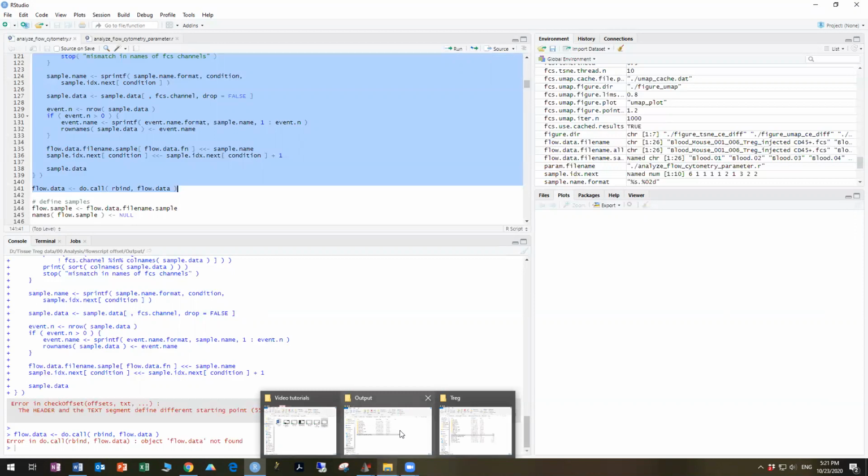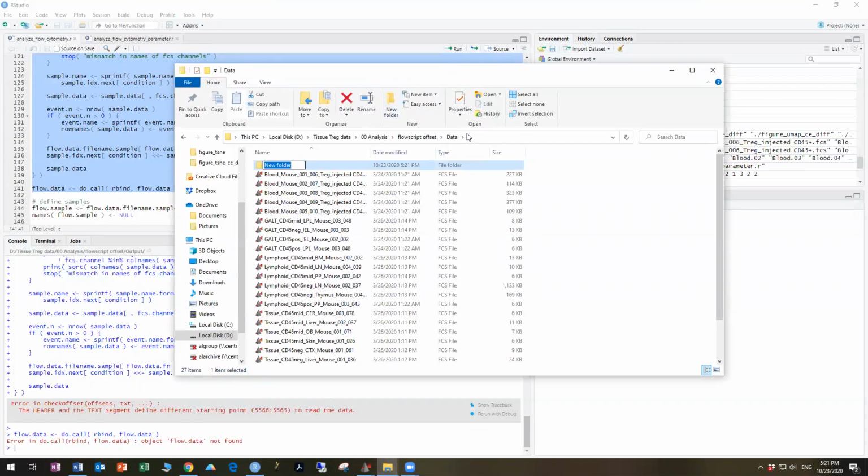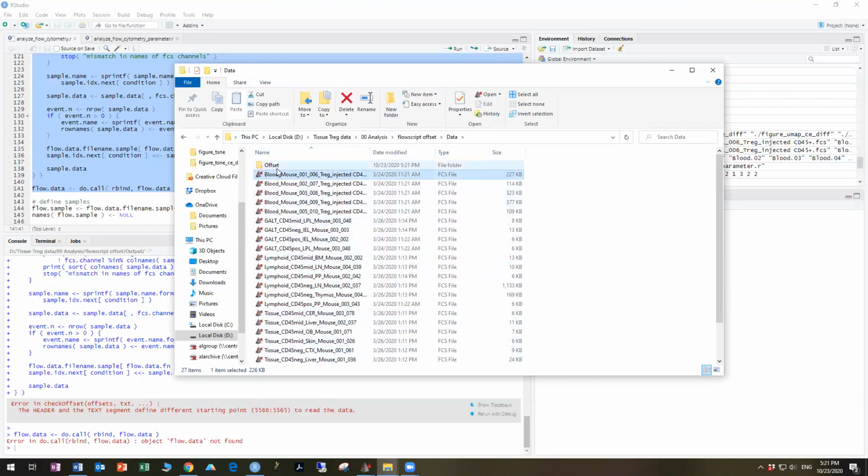So when we see this error, we're going to go back to our data folder and create a new folder that says offset. So the offset files will be moved into this folder. Anything else that you think is a bad sample, you can also move into that folder. So when R looks for the FCS files, it only looks in this folder unless you set it up otherwise. So it's not going to look in subfolders. So you can hide files from it that are problematic.